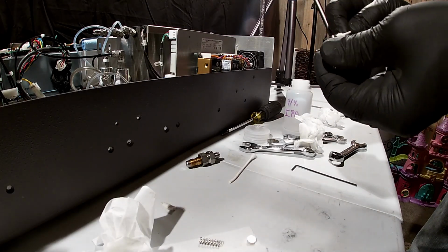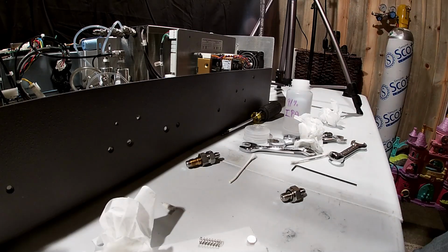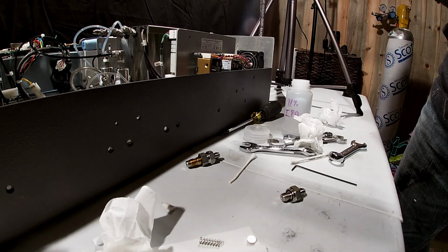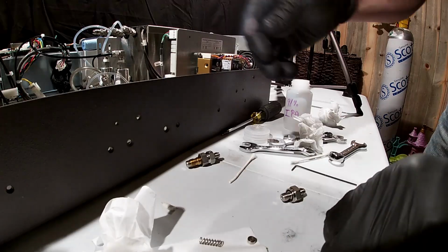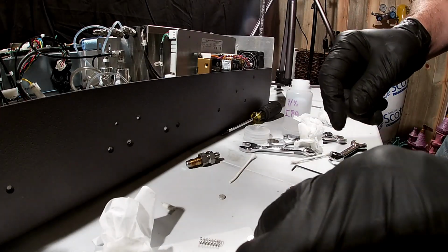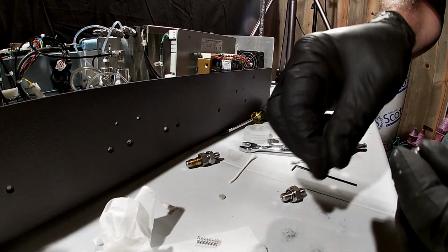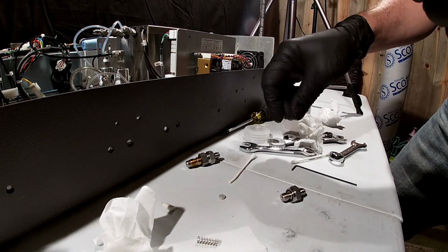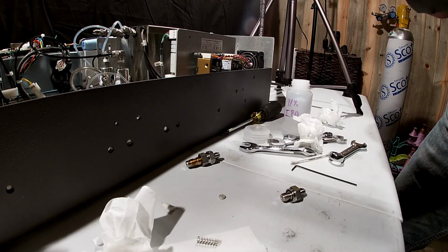Okay, so back to it, cleaning out all these parts. Get a little more on the outside of it. Really, we just want to clean every surface. If we do that, we'll be in good shape. Part of our consumable kit will come with springs and these filters. So if you've got our consumable kit, you'll be all set. Clean this guy off.